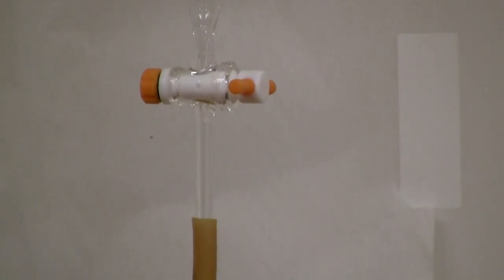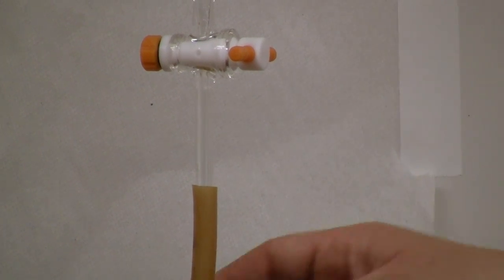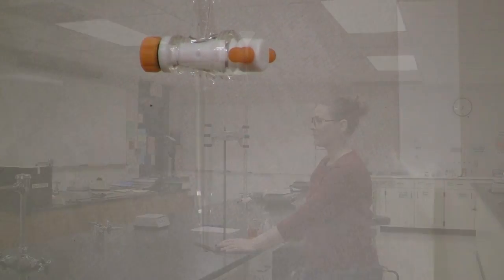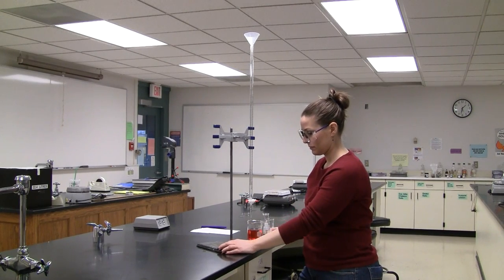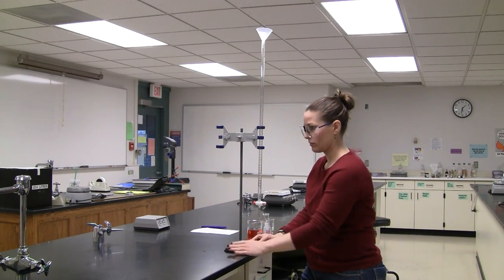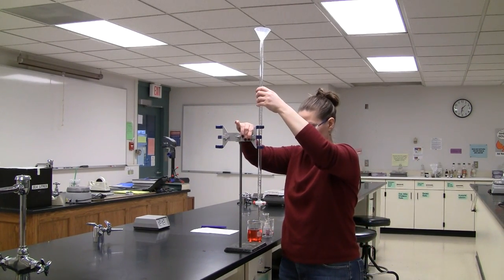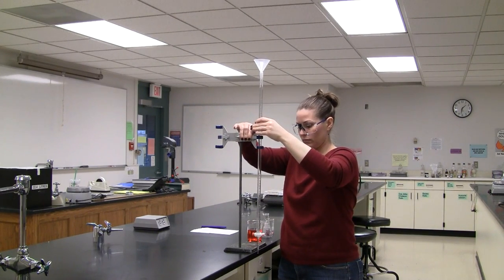A piece of rubber tubing may protect the tip but should be removed before use. To add liquid safely, move the burette to the end of the bench and lower it to eye level. Use a funnel to carefully add a portion of the liquid.